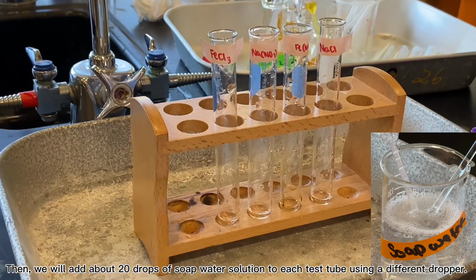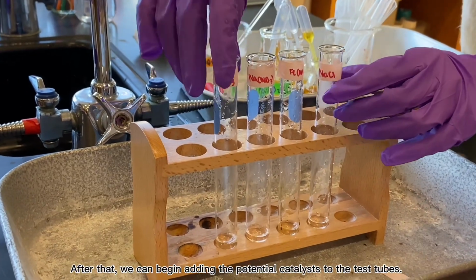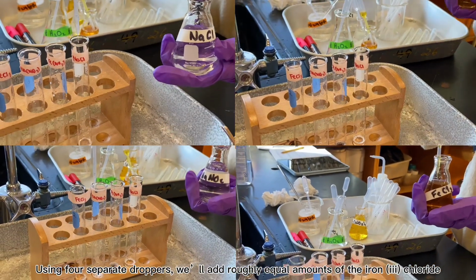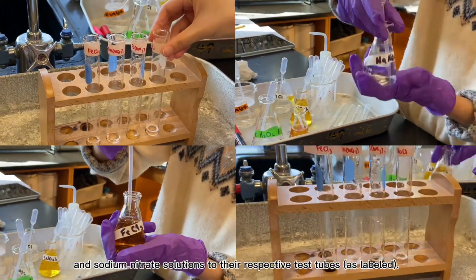Then, we will add about 20 drops of soap water solution to each test tube using a different dropper. After that, we can begin adding the potential catalyst to the test tubes. Using 4 separate droppers, we'll add roughly equivalent amounts of iron 3 chloride, iron 3 nitrate, sodium chloride, and sodium nitrate solutions to their respective test tubes as labeled.